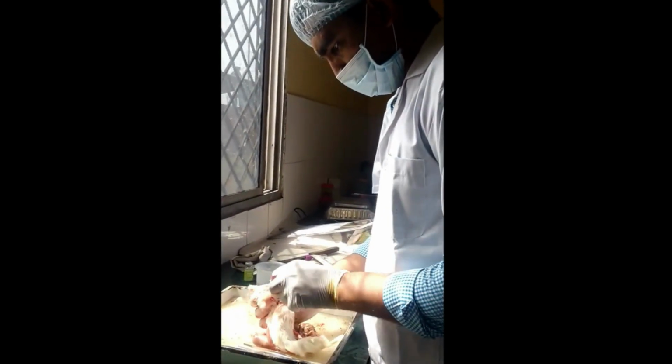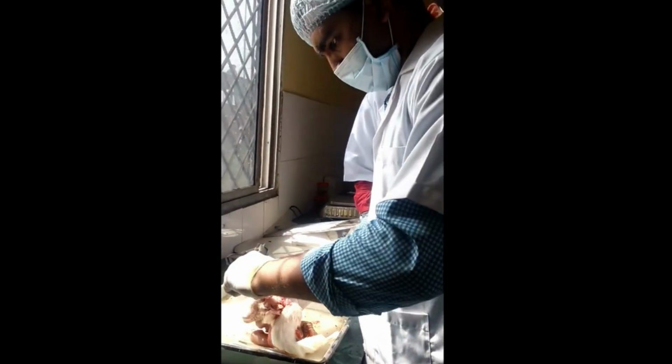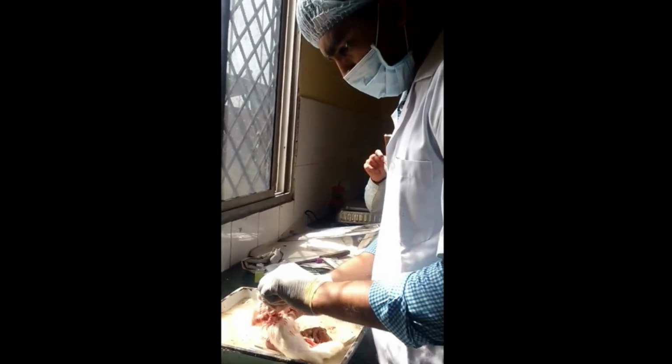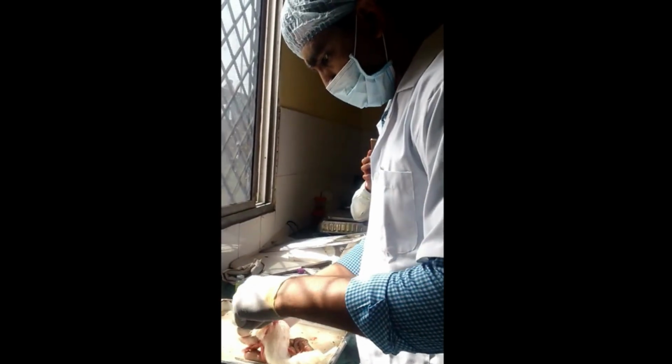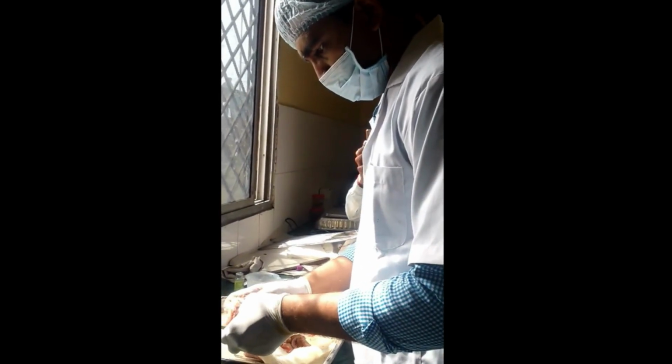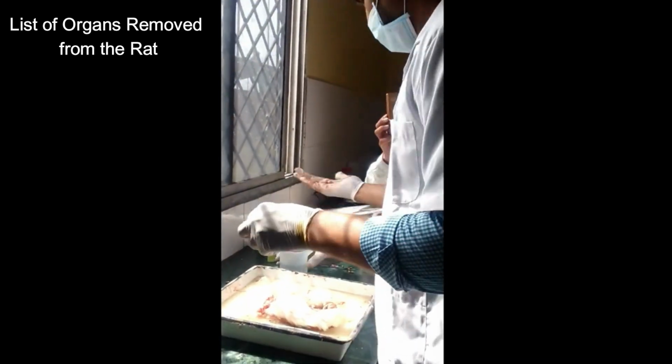And finally, again, I remind you, immediately place each removed organ into the labeled histopathological tube containing 10% neutral buffered formalin solution, and this will preserve the tissues for further analysis.